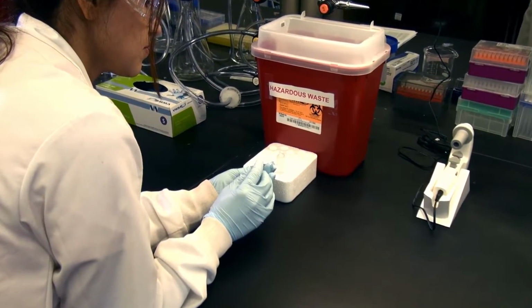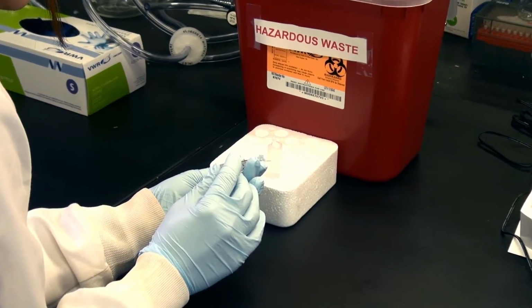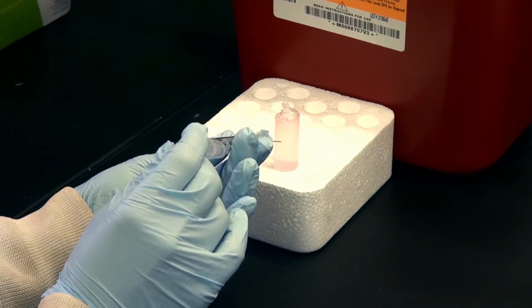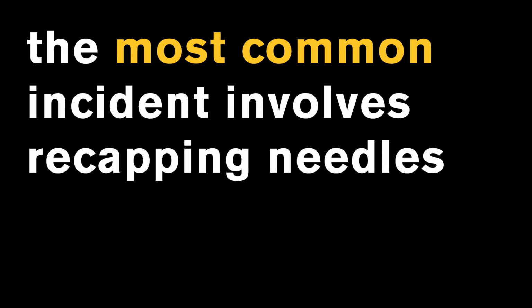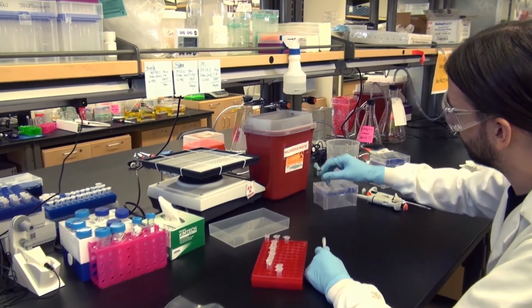This is important because she is now using two hands to hold the needle when the tube is secured. This keeps both hands on the opposite end of the needle. Never recap needles. The most common incident for needle sticks involves recapping needles after use. Always dispose of needles in proper sharps containers.